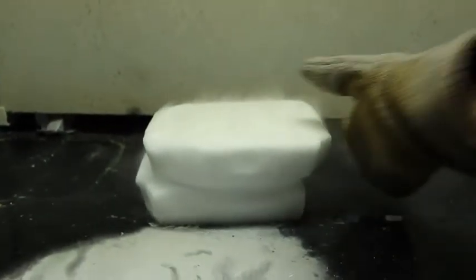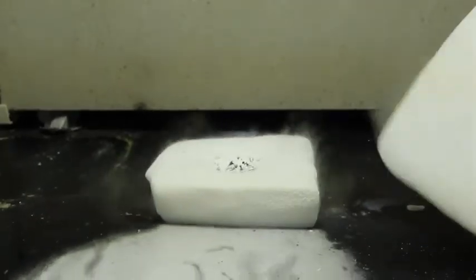I need way more magnesium. I need to clean it out. Just like, psh, psh, psh. It was so bouncing cool. Everywhere. Wow, that was really neat. Good job, Ryan. Let's see what's left. Oh, thank God.